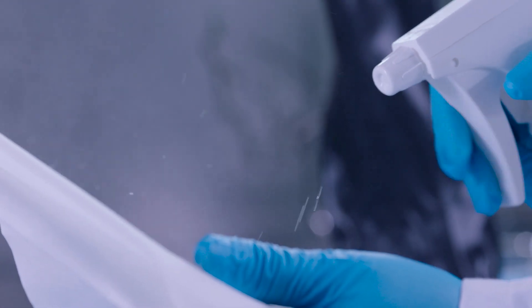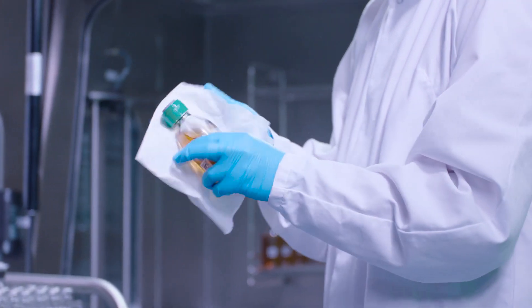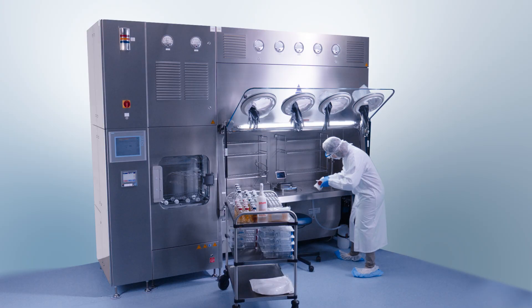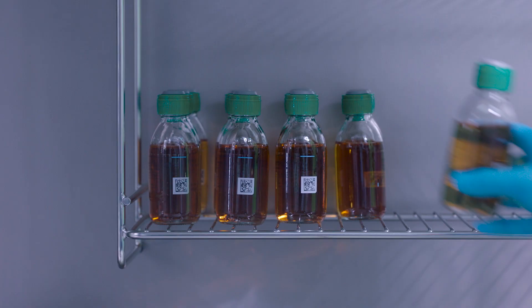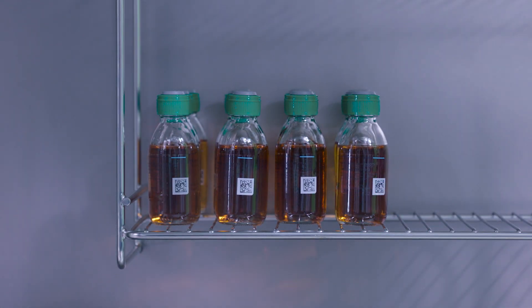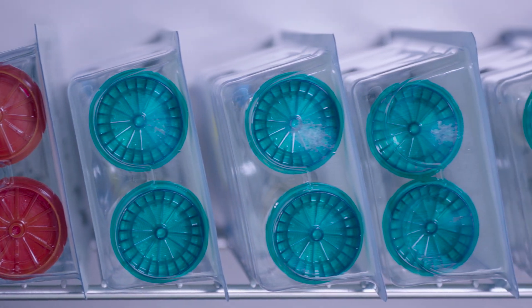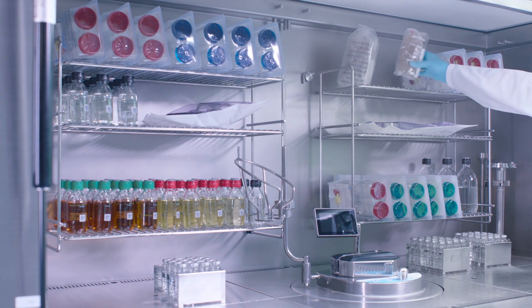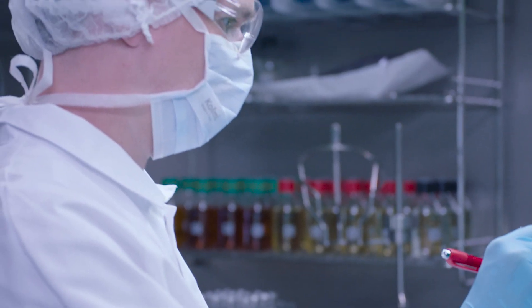The floor inside the isolator offers sufficient space for performing up to 15 tests. When loading the isolator, it is important to leave enough space between the materials. This ensures proper decontamination by hydrogen peroxide. A checklist must be used to verify the load.